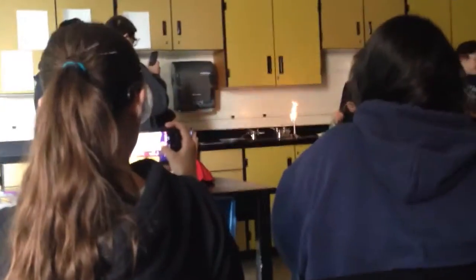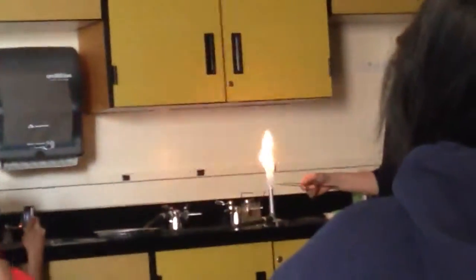We've got these nice big long tongs because they will get super hot — we have to keep it in the flame for so long. So now let's notice what's happening with the flame. There's no difference between the magnesium in or out right now. But as the magnesium starts to heat up, you'll start noticing some things happening in your flame.